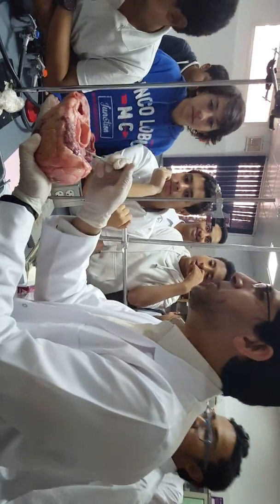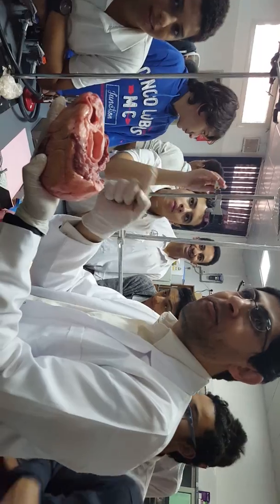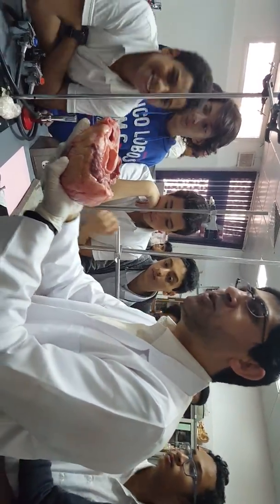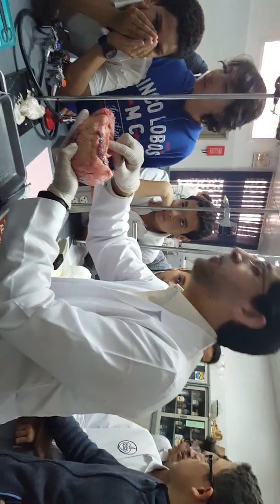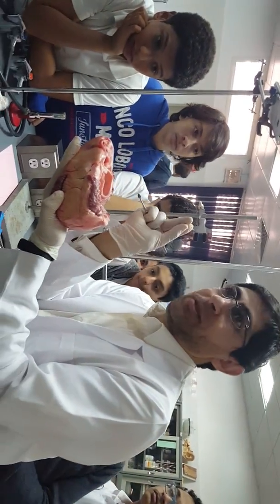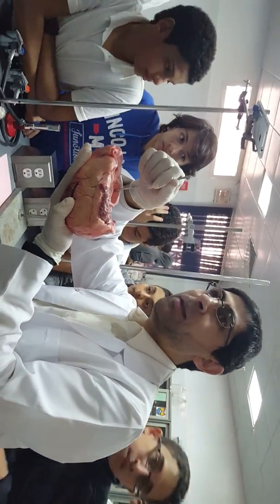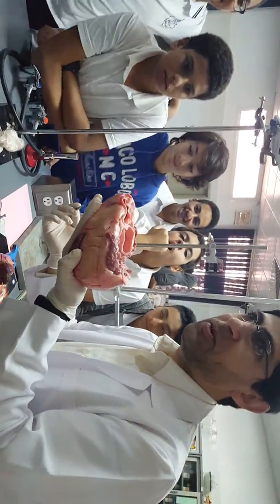By the way, this one is open because of the pressure, so the atrioventricular valve will be open. Okay. In contrast, while the ventricle relaxes, the semilunar valves in the base of the aorta and pulmonary artery will be closed in order not to allow the blood to backflow from the aorta and pulmonary artery back to the ventricles, to prevent the backflow of the blood.